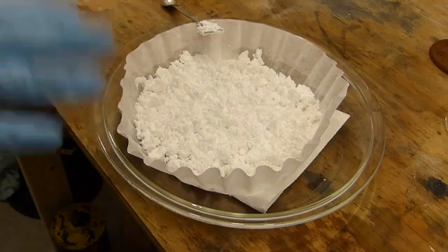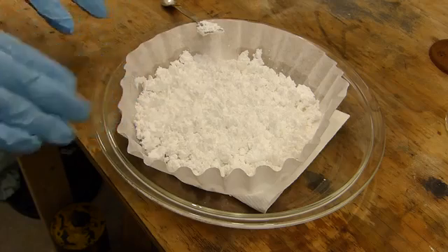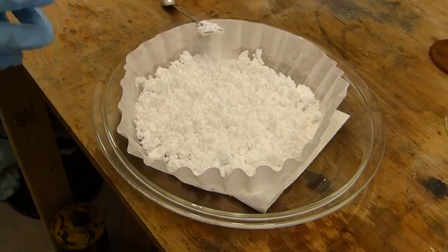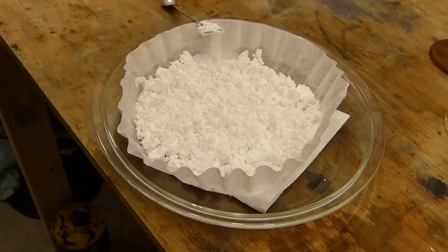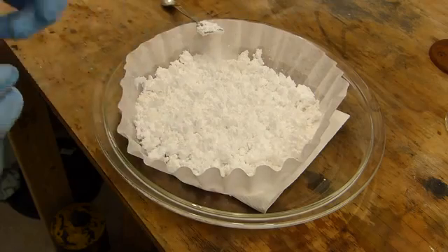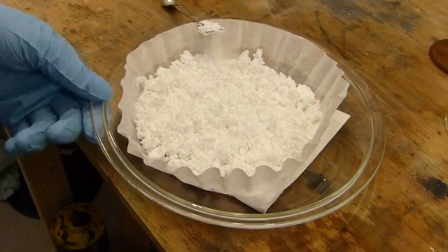But also that any excess acid in the form of HCl will simply evaporate off at this step. So if you had sulfuric acid or something like that, at this point it would stay with the benzoic acid and be introduced as an impurity. Instead, we're just going to evaporate all the acid off. And this should be fairly pure benzoic acid as soon as it's done drying.